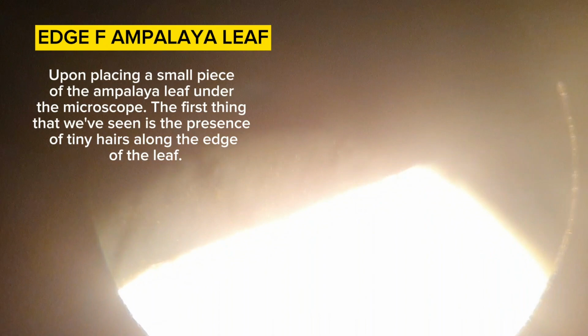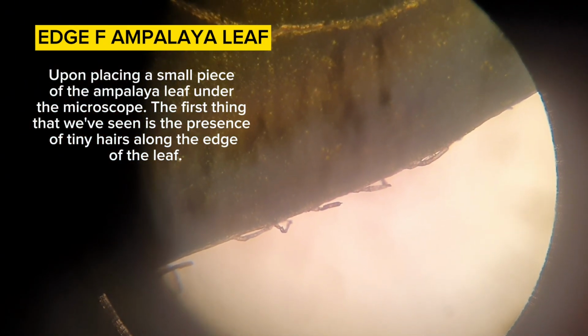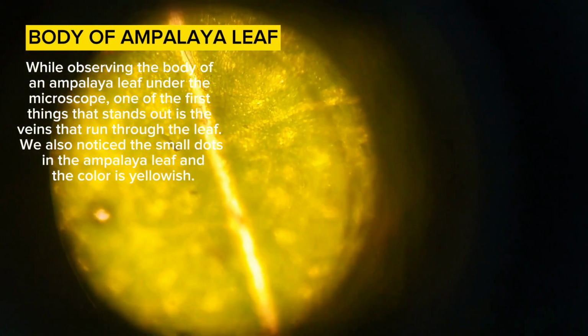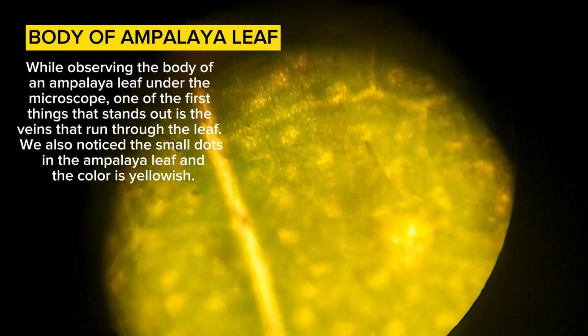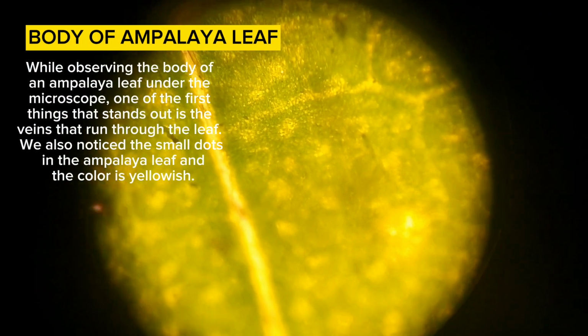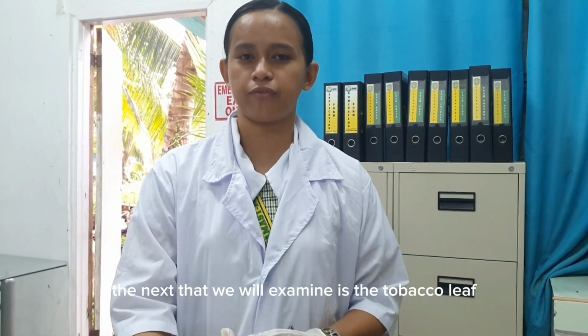Upon placing a small piece of the ampalaya leaf under the microscope, the first thing that we saw is the presence of tiny hairs along the edge of the leaf. While observing the body of an ampalaya leaf under the microscope, one of the first things that stands out is the veins that run through the leaf. We also notice small dots in the ampalaya leaf and the color is yellowish. The next we will examine is the tobacco.